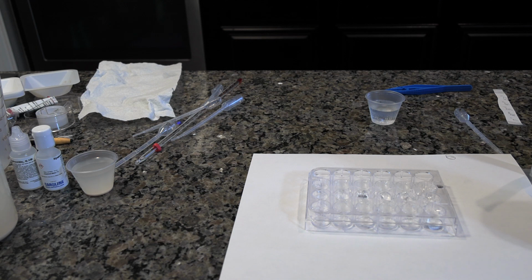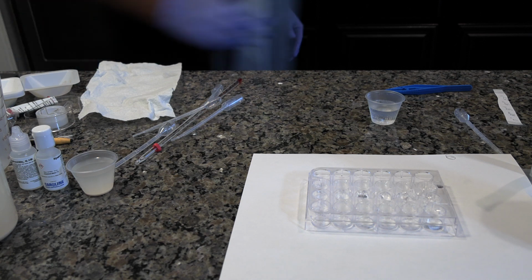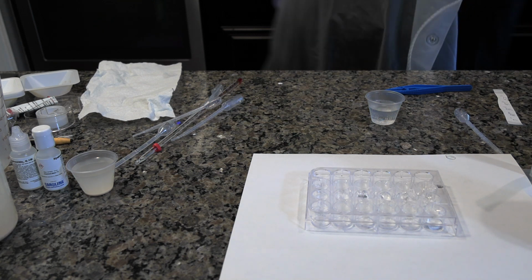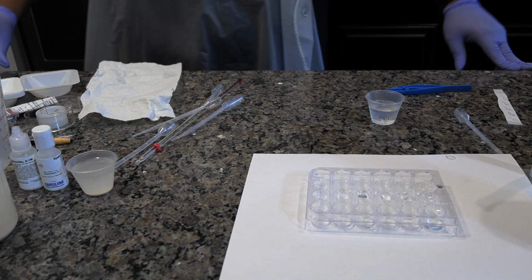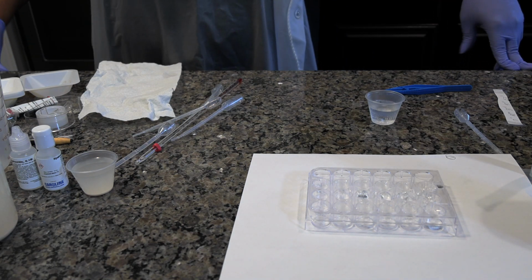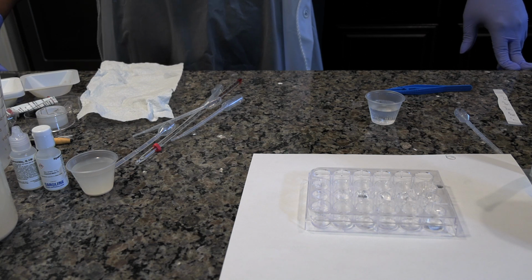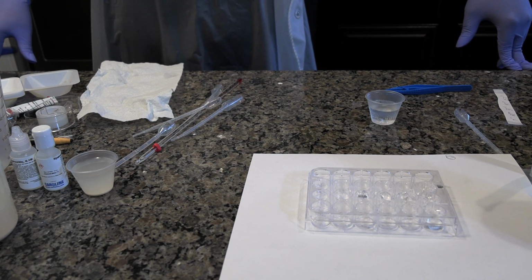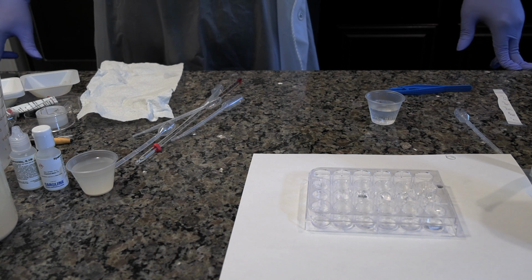For each concentration of acid or base, calculate the average time for the disc to rise to the surface of the peroxide and record the values in data table 3. Measure the height of the 1.5% hydrogen peroxide solution to the nearest 0.1 centimeters and record in data table 3. Calculate the rate for each concentration and record the values in data table 3. Plot your graph.